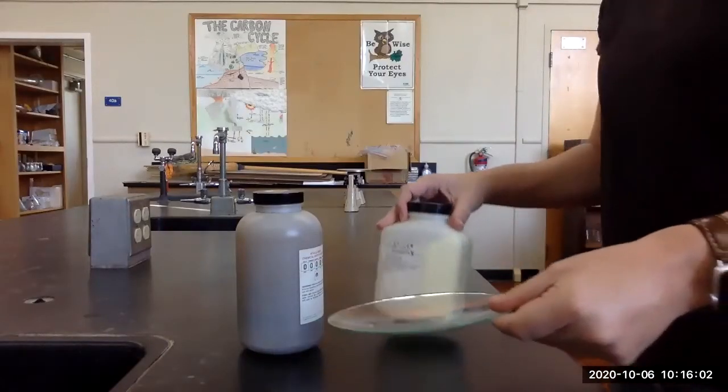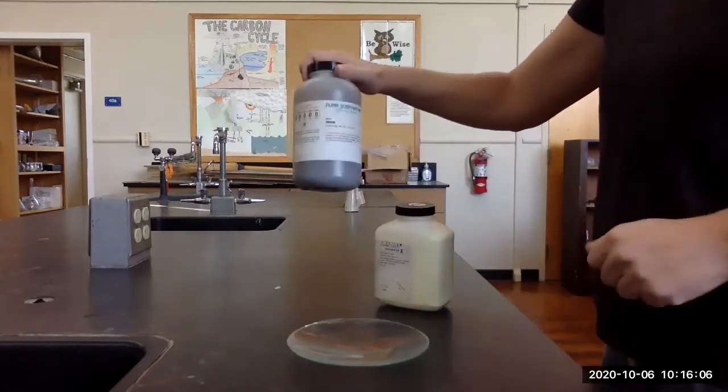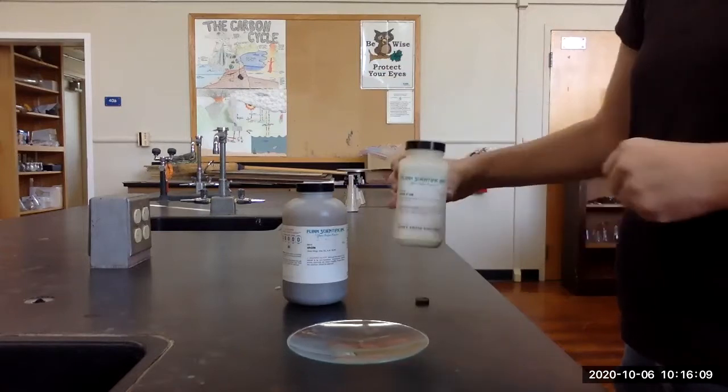Here I have a watch glass and on the watch glass I'm going to put some iron filings and some sulfur.